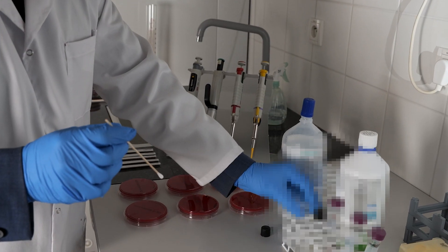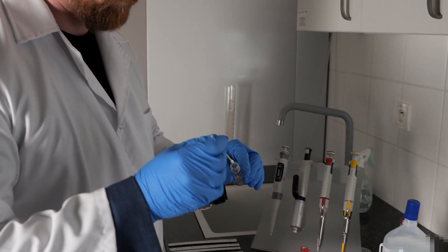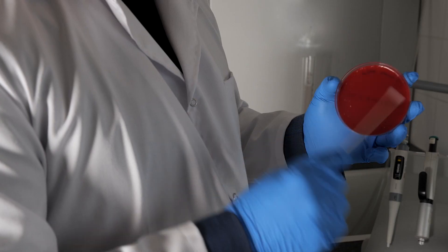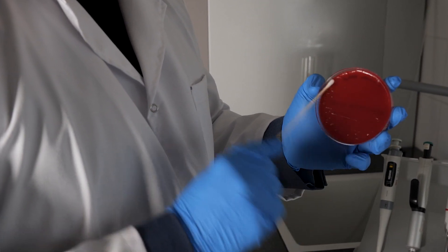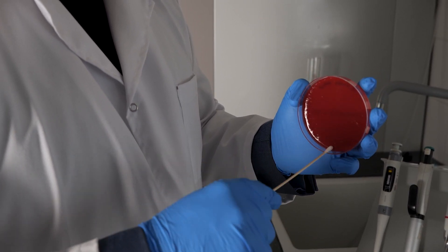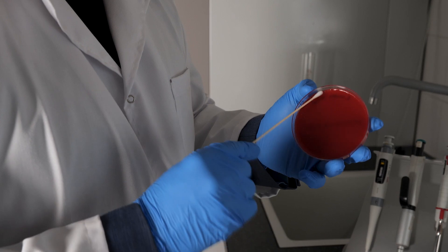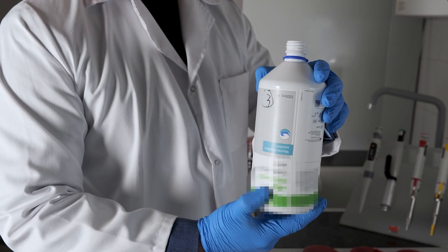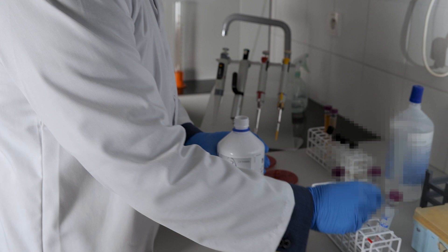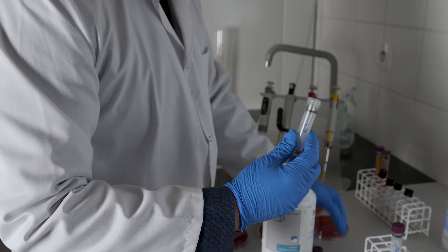To help clarify this issue, we have prepared a very simple yet very convenient in vitro model. We basically took an agar plate and Staphylococcus aureus bacteria, spread the bacteria on the plate, then poured a drop of antiseptic on the plate and incubated it.